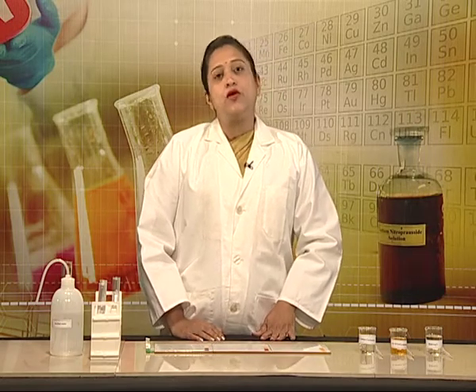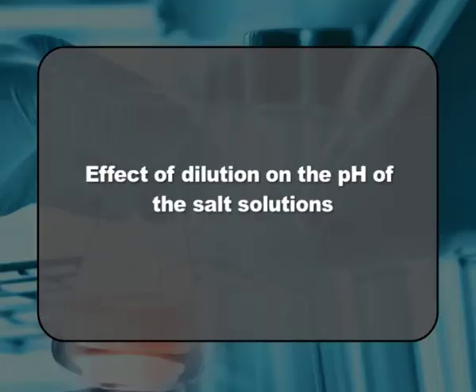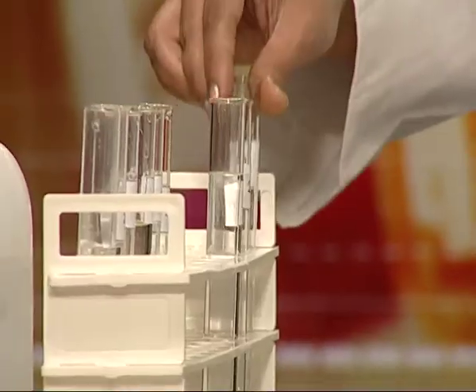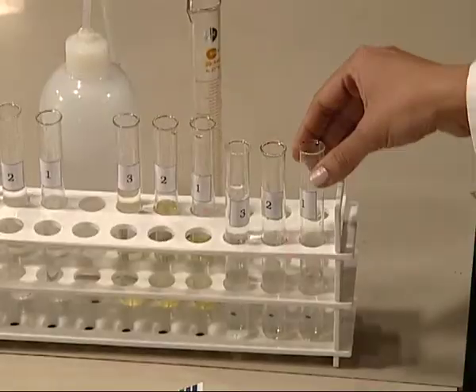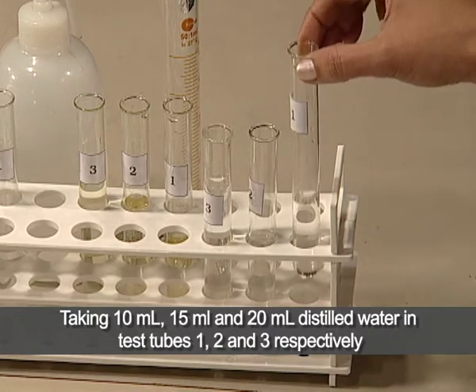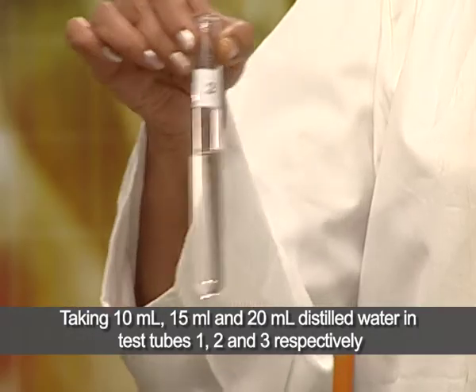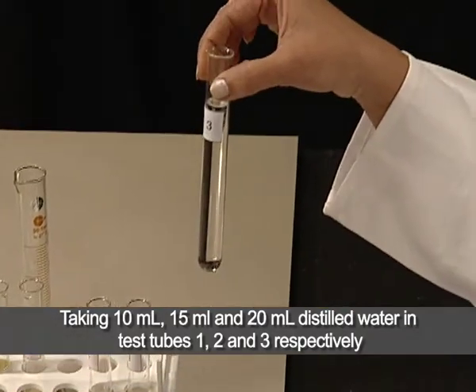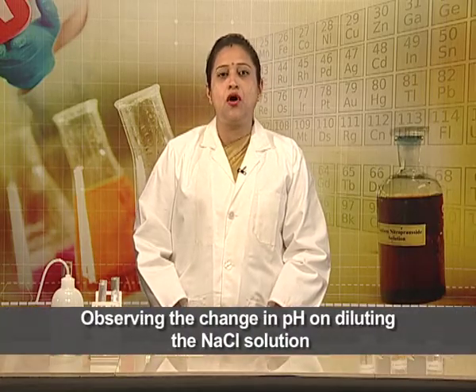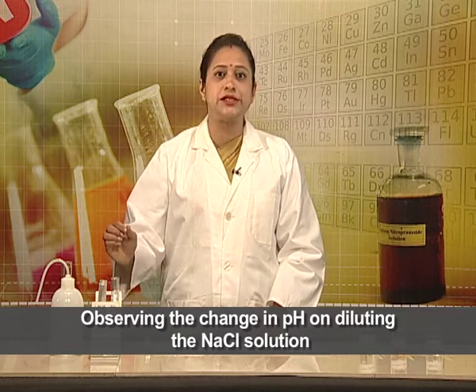Now let us move on to the second part of our experiment — to study the effect of dilution on the pH of these salt solutions. We have already prepared 3 test tubes: test tube number 1 with 10 ml of distilled water, test tube number 2 with 15 ml of water, and test tube number 3 with 20 ml of distilled water. We shall now add 1 ml of sodium chloride solution to each of these test tubes.